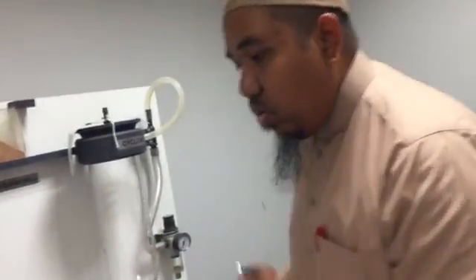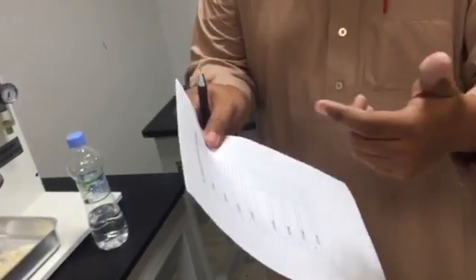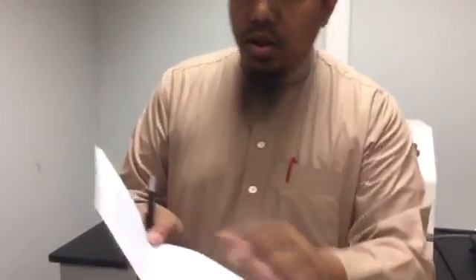So you mention, for example, the first run, the sample size is, let's say, 300 micron, the condition dry, the angle of repose is 34. Another size, with dry condition.